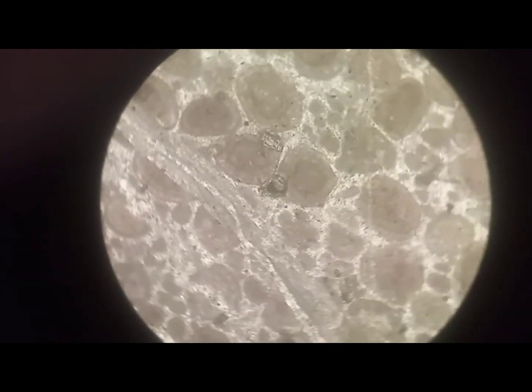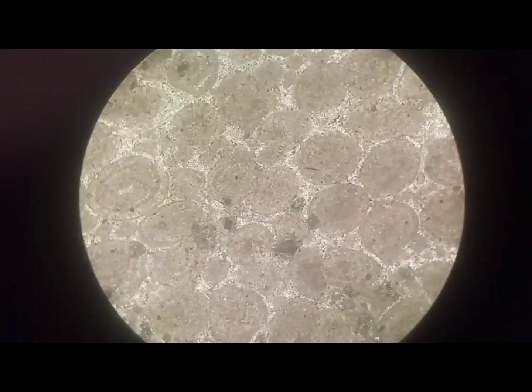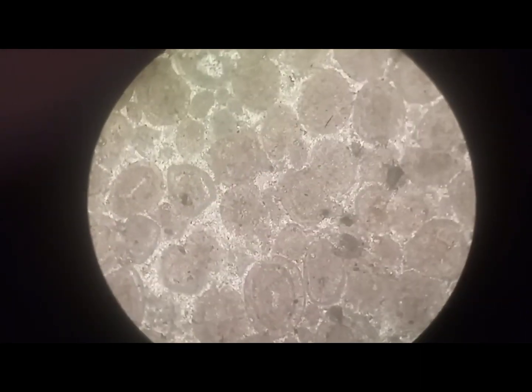Ooids are small spherical grains that form when a particle is coated with concentric layers of calcite and other minerals. These are indicative of warm and shallow coastal waters.